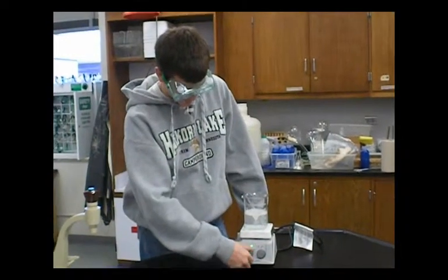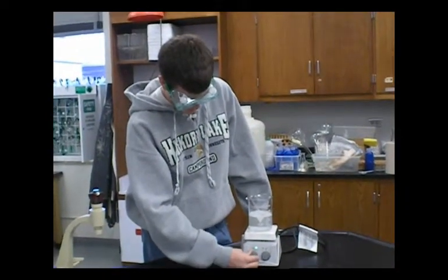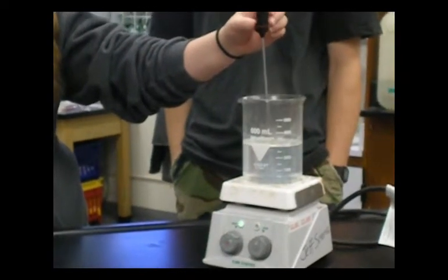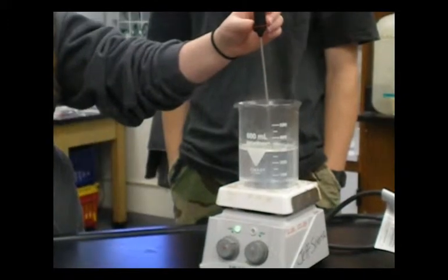Heat the solution until it boils. Once the solution boils, take the temperature every 15 seconds.